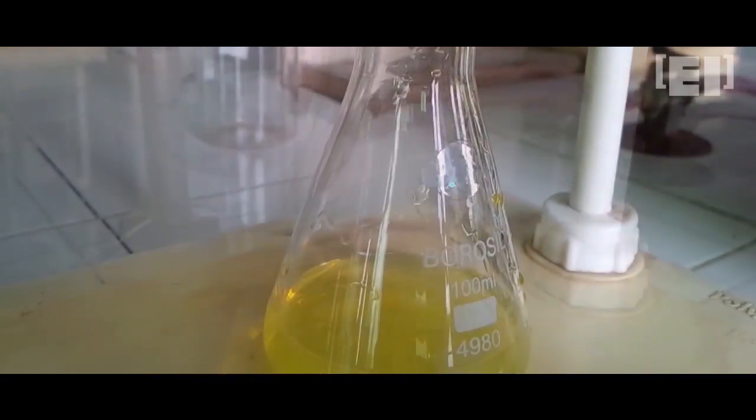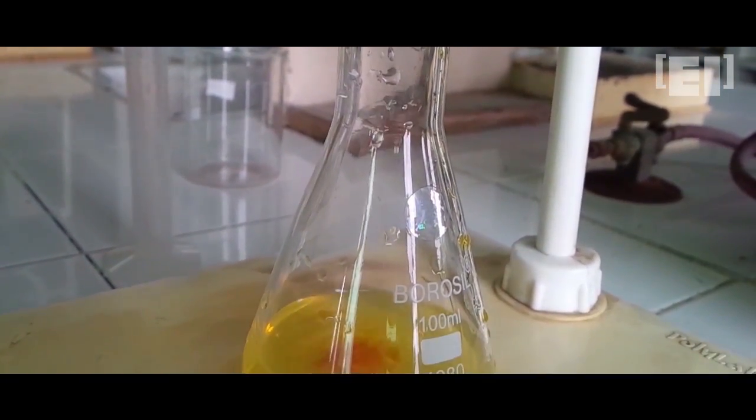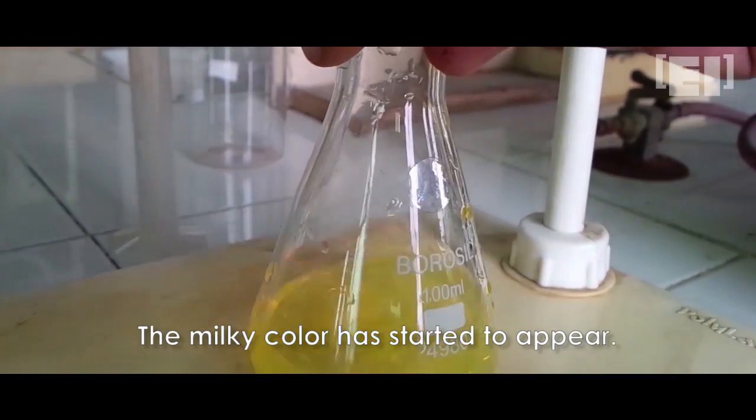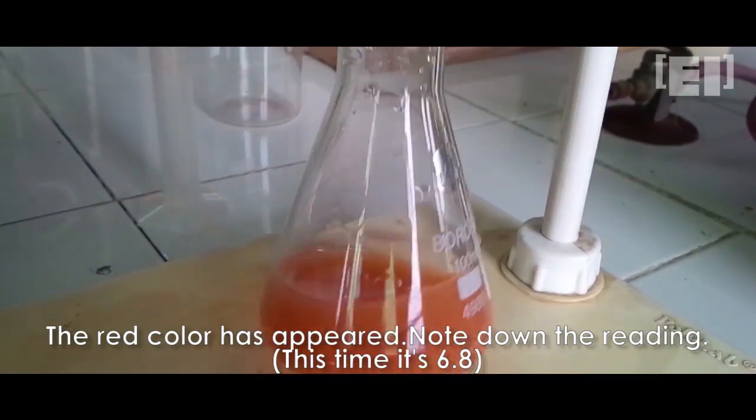If two of the readings match, then we will take that reading as our final reading for calculations. This time the reading is 6.8 ml.